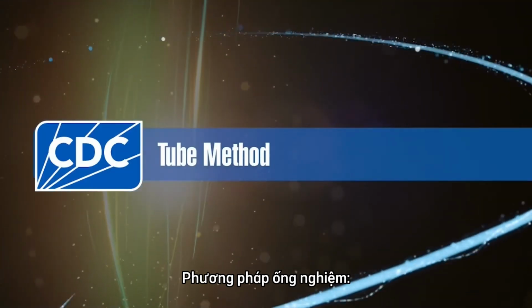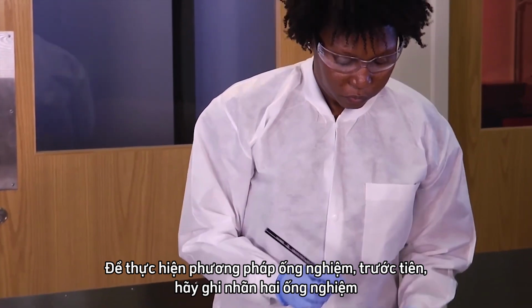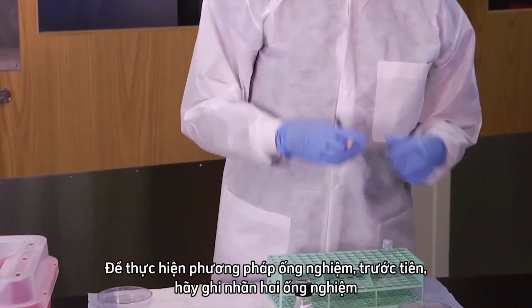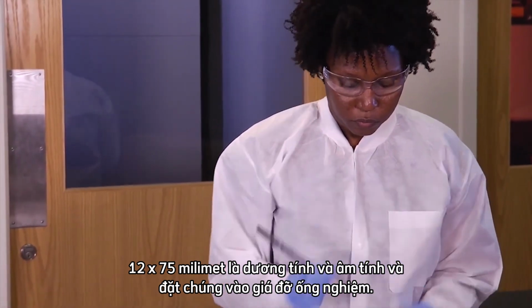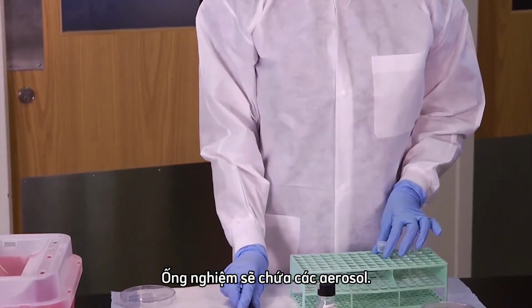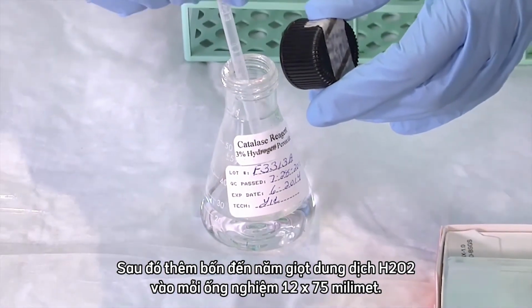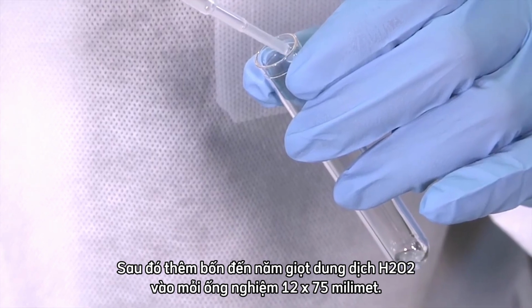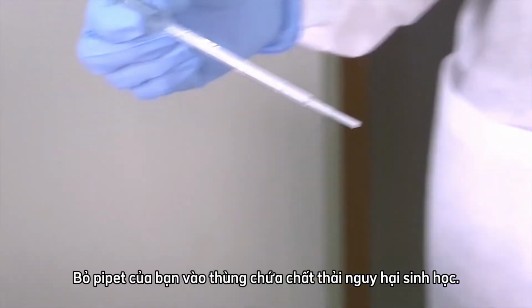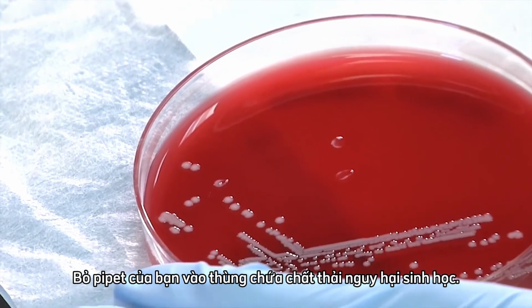The tube method. To perform the tube method, first label the 2 12 by 75 millimeter test tubes positive and negative and place them in a test tube rack. The tube will contain the aerosols. Then, add 4 to 5 drops of H₂O₂ solution to each of the 12 by 75 millimeter test tubes. Discard your pipette into a biohazardous waste container.